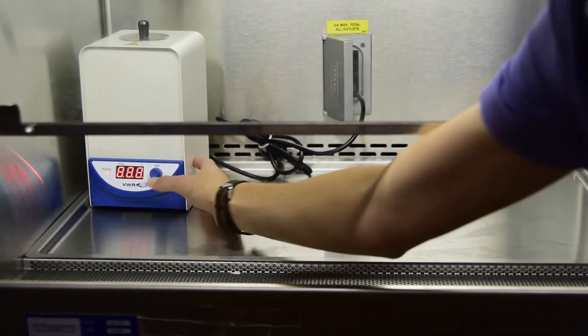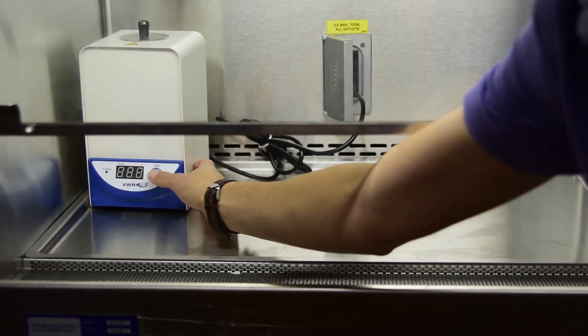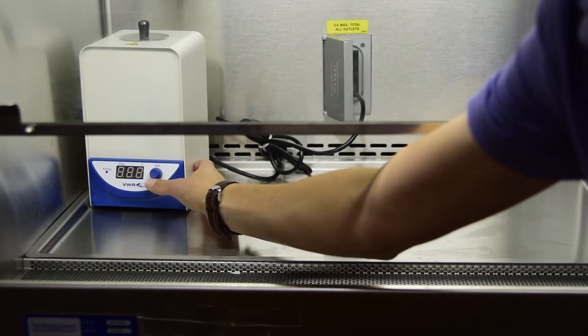Hold the right button until the temperature flashes, usually 280 or higher. It will start heating and show the current temperature.